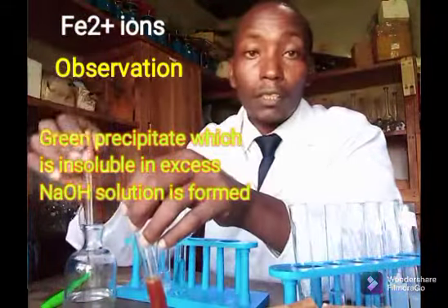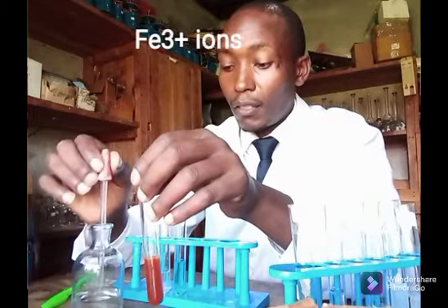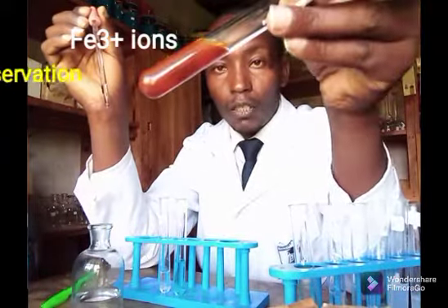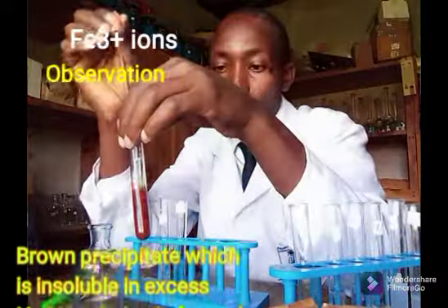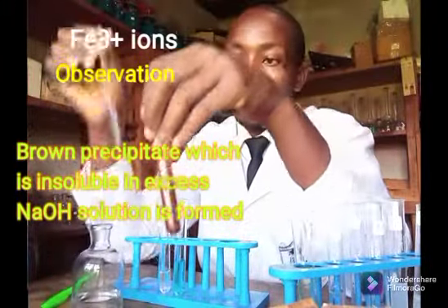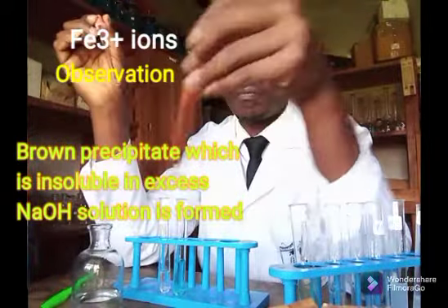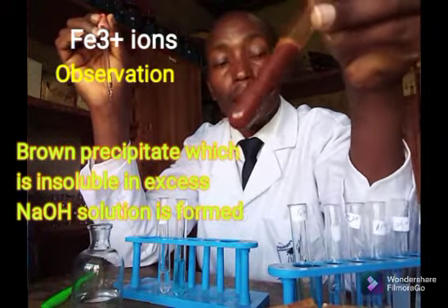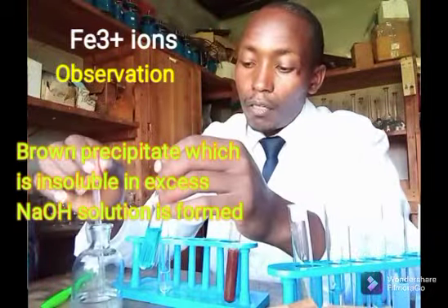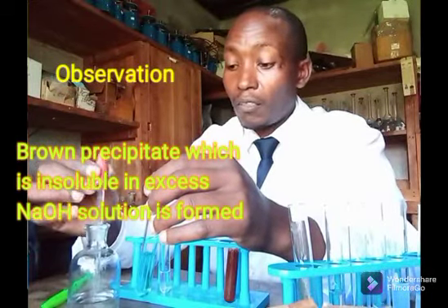Another solution here containing the iron 3 ions. If you're keen to observe, a brown precipitate has been formed. A brown precipitate has been formed. If I keep adding and I add excess of it, good, a brown precipitate that is insoluble has been formed. When you put excess of sodium hydroxide, the precipitate does not dissolve.